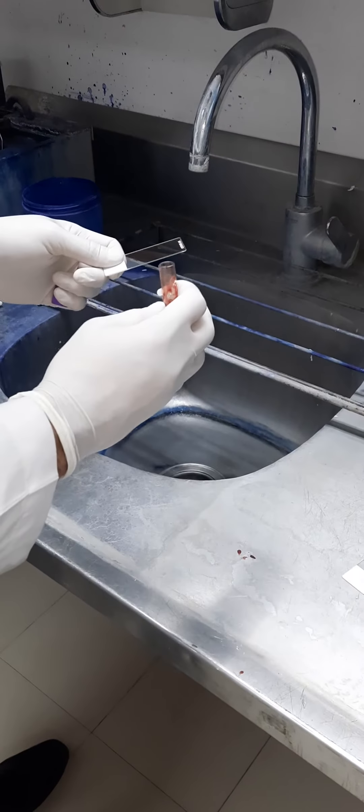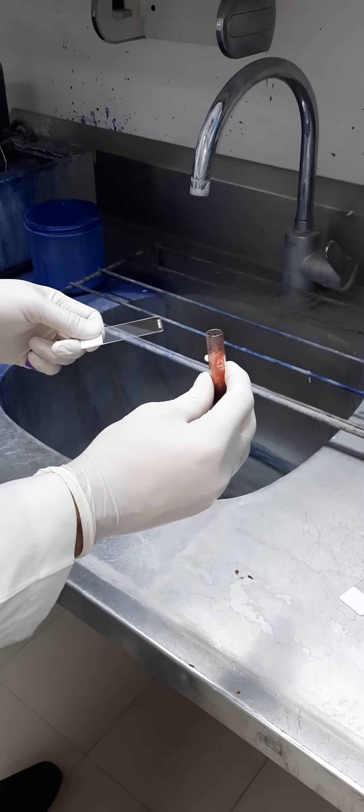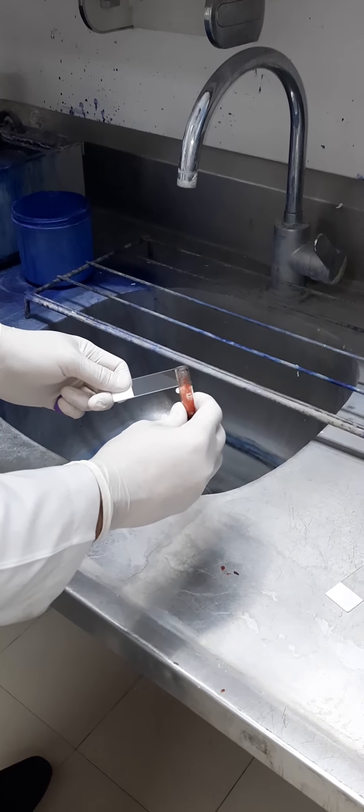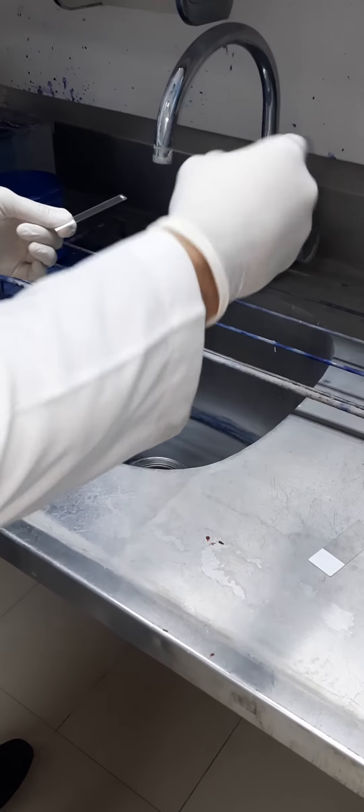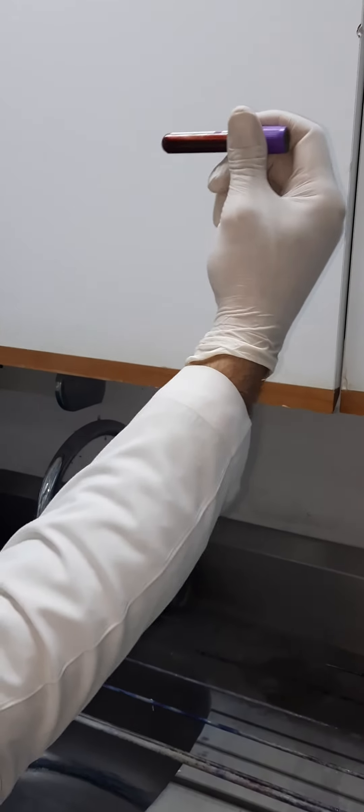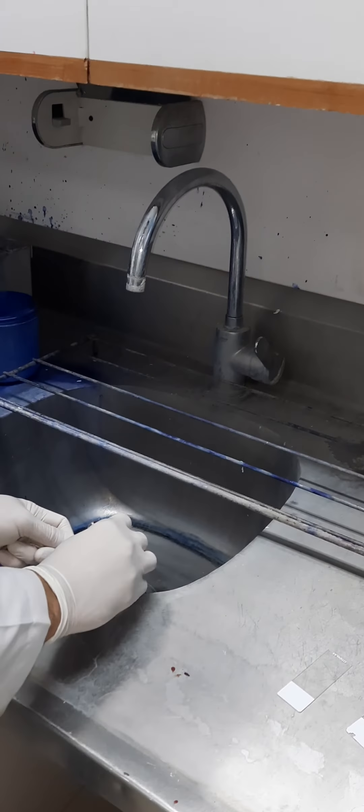This is the way to pass bone marrow slides with particles. First, we have to make sure that the particles are there in the sample, then we have to mix it properly and thoroughly.